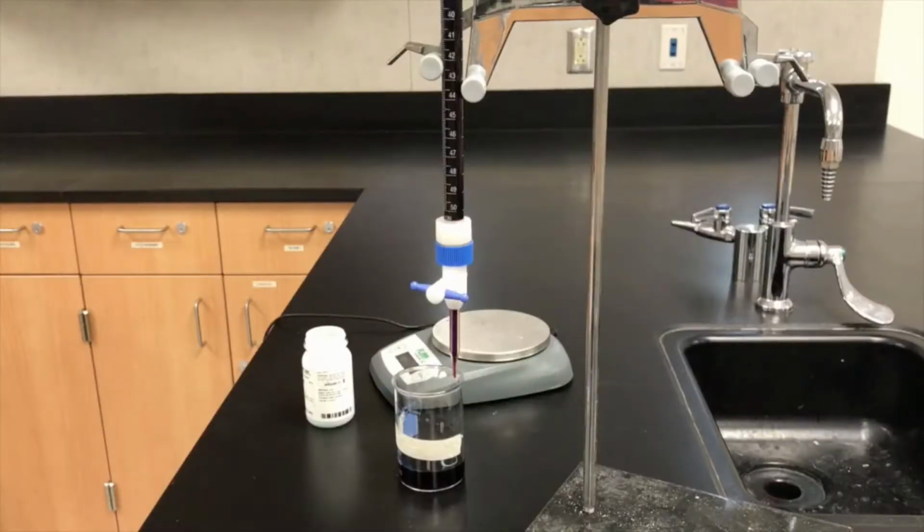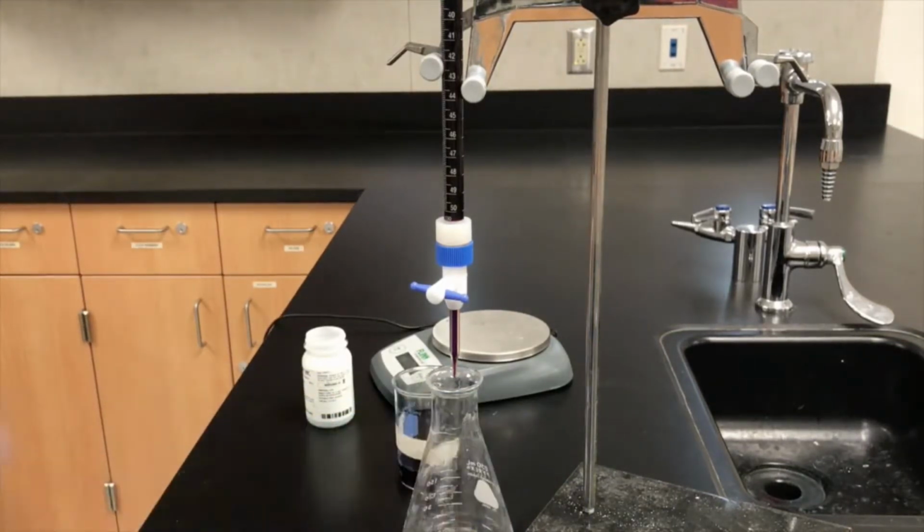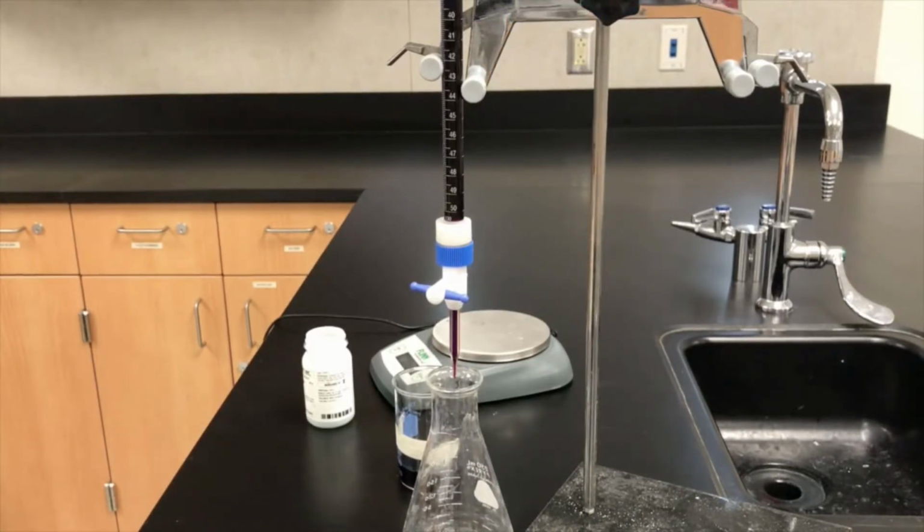Okay, so then it says position the flask under the burette so that the tip of the burette is within the flask, far above the liquid. So it's going to look like that. You're going to put it right under there, make sure it doesn't touch, and there you go. All right, and you're actually going to be holding the flask in all likelihood.